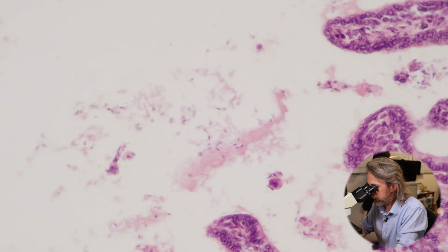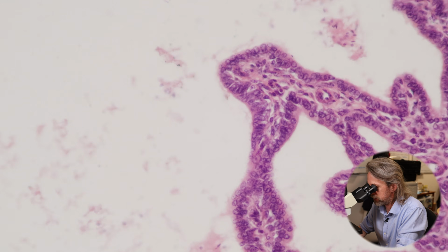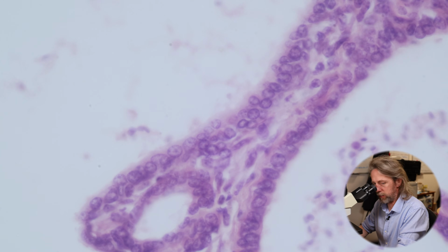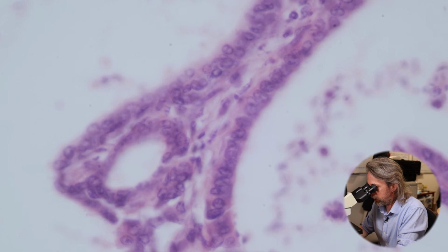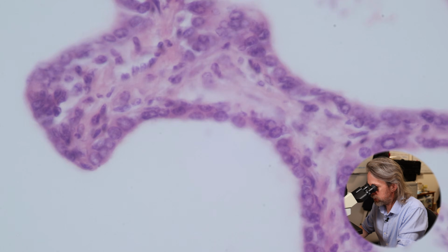So the epithelium that we see inside the seminal vesicles often gets described as simple. It sometimes gets described as pseudostratified. It sometimes gets described as columnar, and it sometimes gets described as cuboidal. We will only say what we see. And these cells really don't look tall like the cells in the prostate gland did, do they? These look quite cuboidal, but it doesn't quite look simple, does it? Doesn't quite look like a single layer. It looks like you've got a couple of layers of cells smushed together there. Hence the confusion of the description.